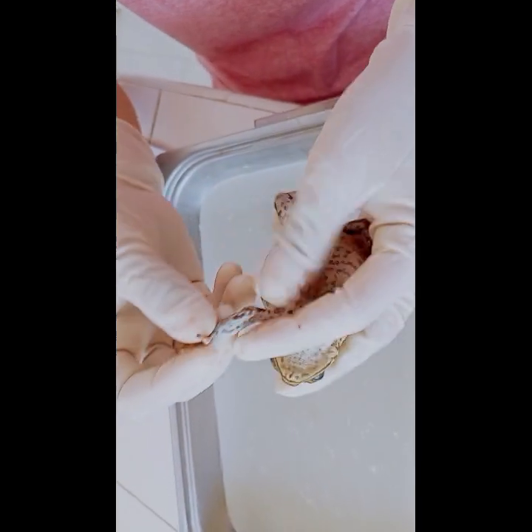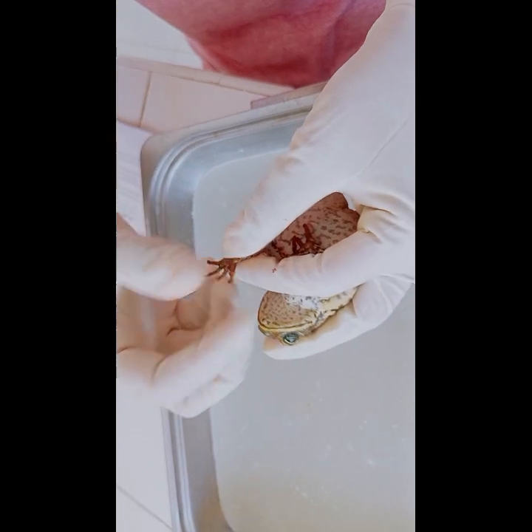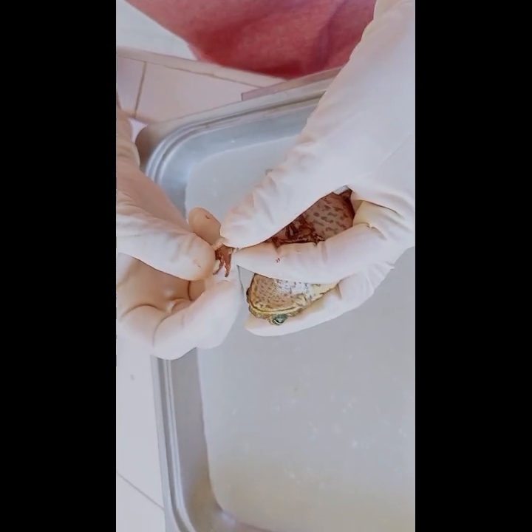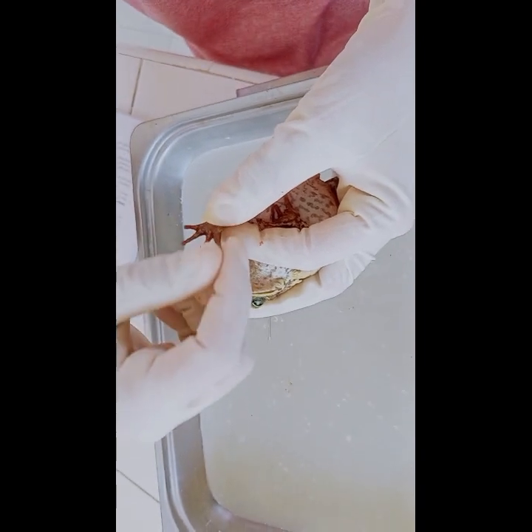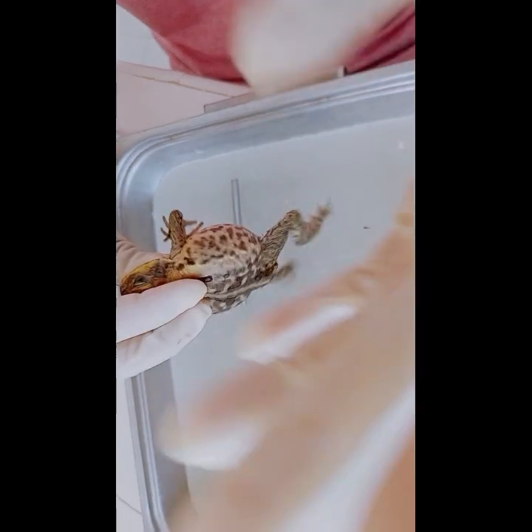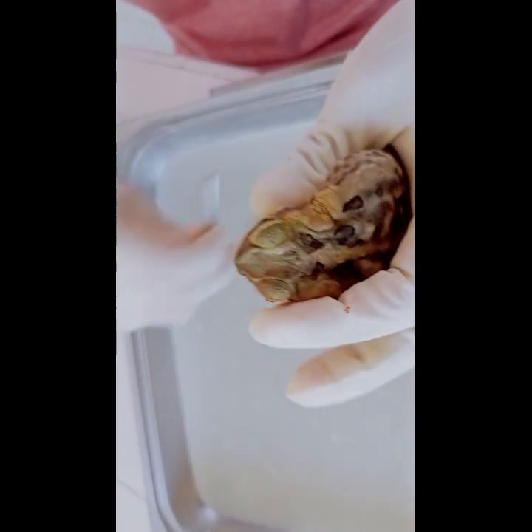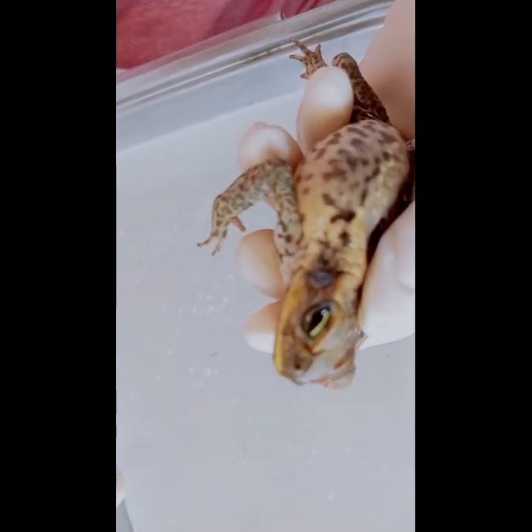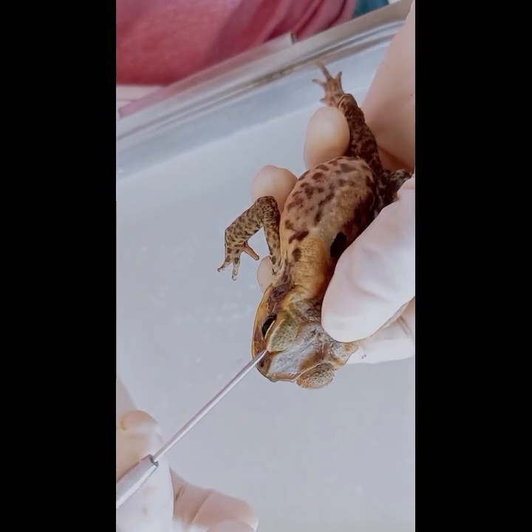We can see that the frog has a large thumb, and we can guess that the frog is male because of knowing that the frog's thumb is large. The large thumb on the forelimbs of a frog is used for gripping and grasping objects such as branches or prey. Now we will locate the bulging eyes of the frog.